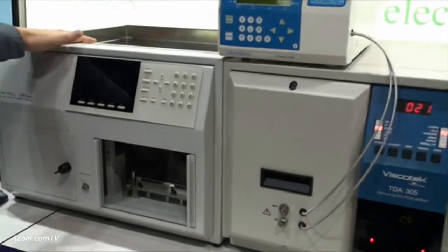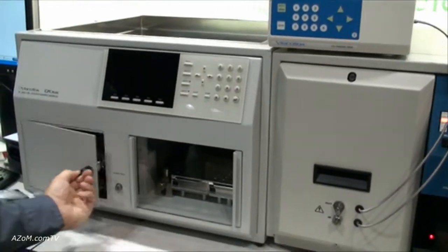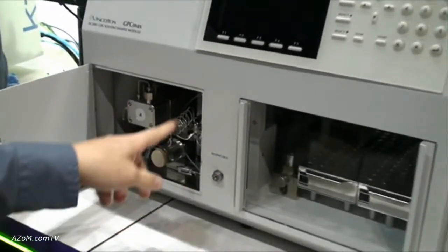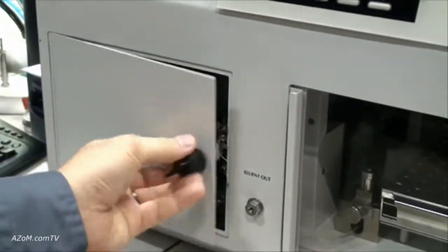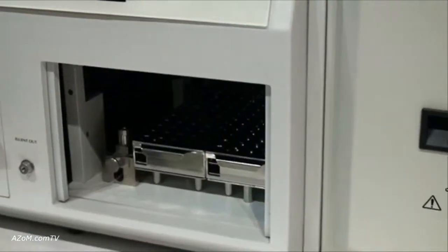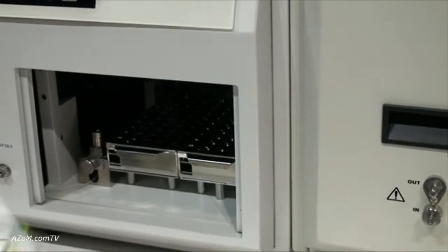This is the GPC Max Auto Sampler, fully equipped with pump and degasser. On this side is the Auto Sampler, capable of fitting 2 mL and 20 mL vials and an injection port.